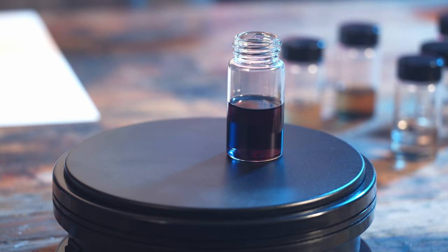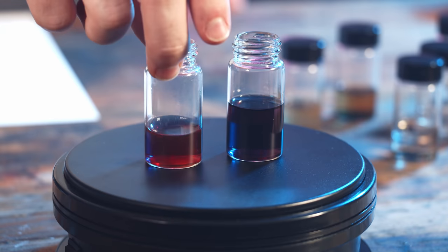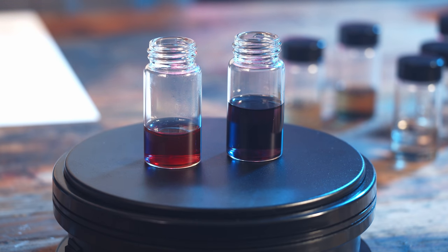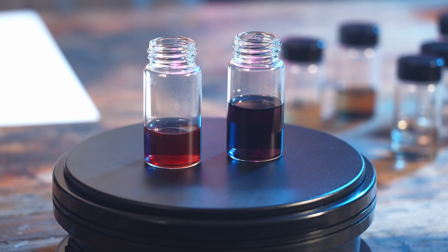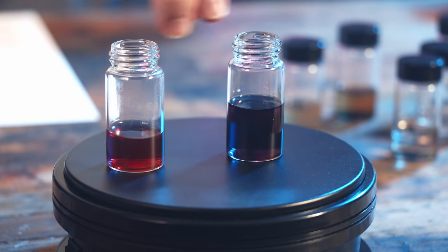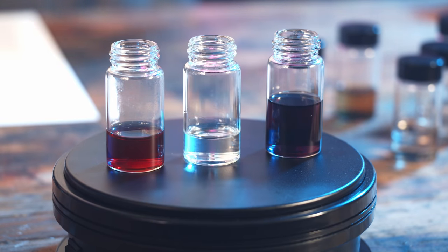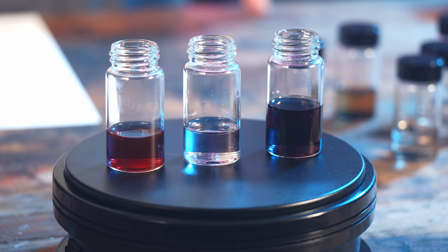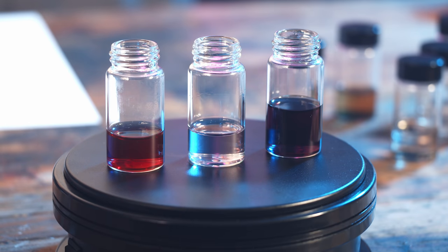This is a vial of gold nanoparticles, and this is another vial of gold nanoparticles. But clearly they have different colors — this one's kind of a purple-y violet, and this one's more of a ruby red. You might think the difference is simply due to concentration, but if we dilute down the purple vial, you'll see that the color doesn't change. It stays a violet color, just more transparent. So the difference is not due to particle concentration — there's something else going on that makes these two vials of gold nanoparticles look different even though it's the same metal.